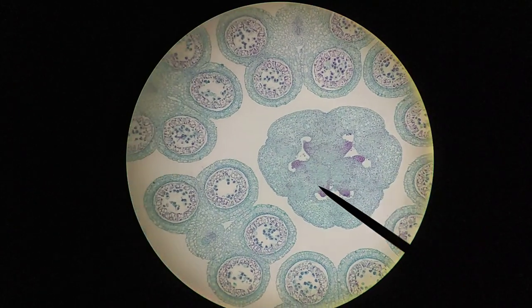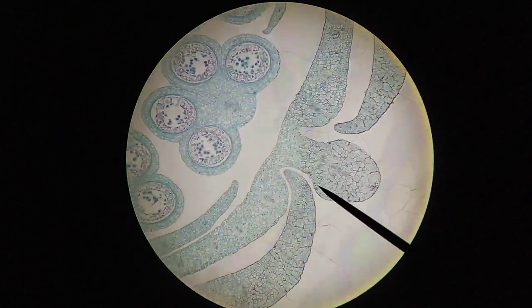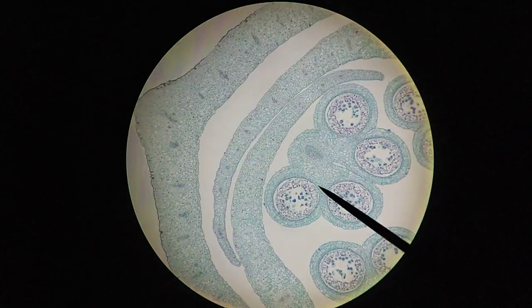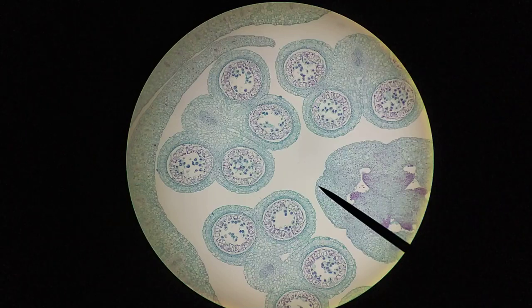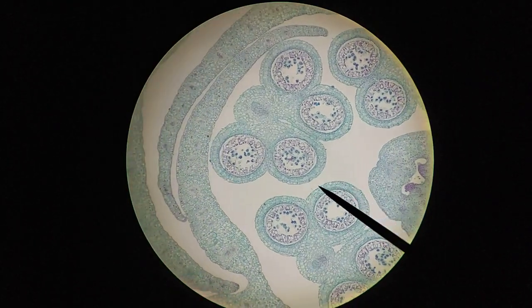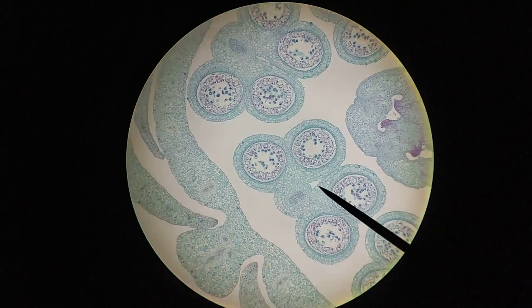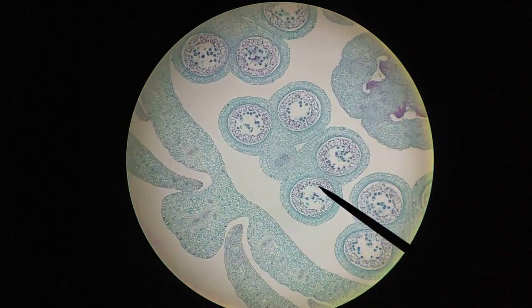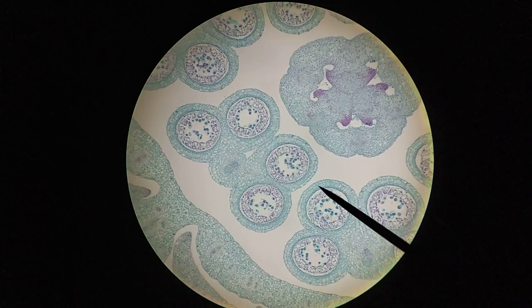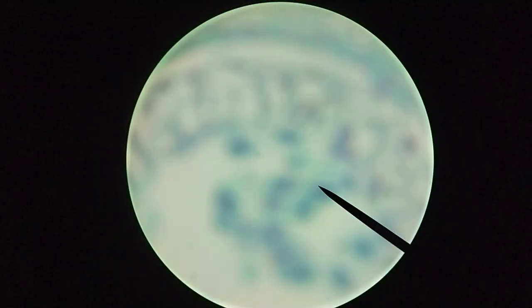We're looking at another flower bud in cross-section. This one's a little bit later in development — probably a couple of days older. What you're seeing again are anthers with locules, and the locules inside have some microsporocytes. Let's take a look at one of these locules, put it in the center, and zoom in. Going to 100x and then 400x — and what we're seeing here already is something that looks a little bit different than what we just saw.